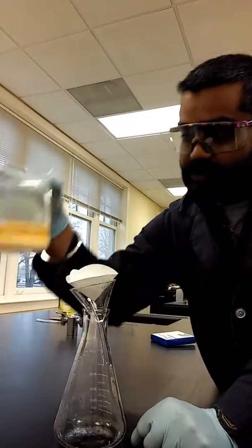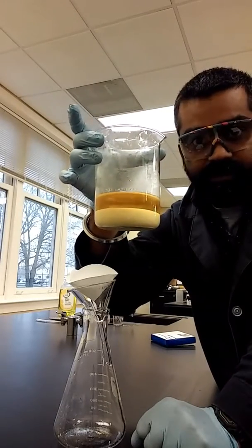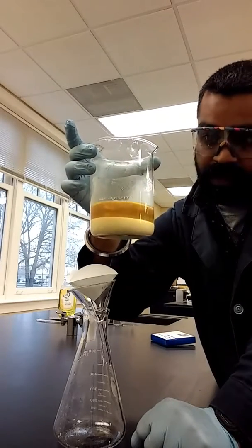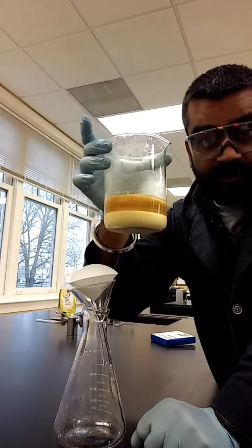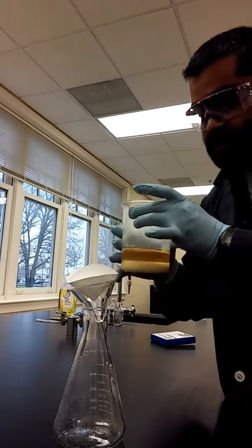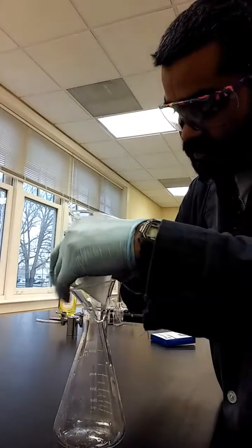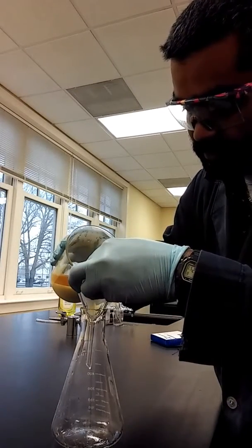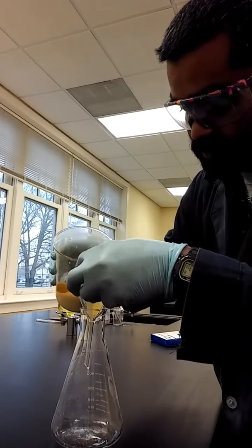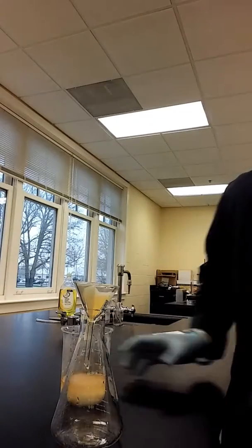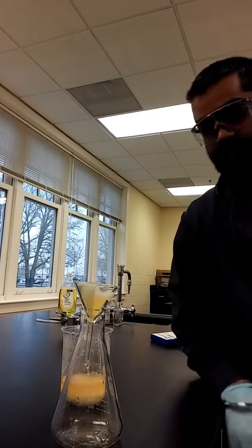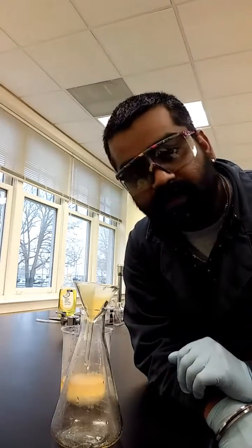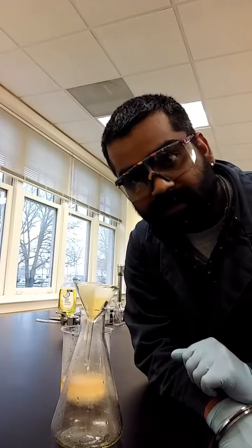Finally, the solution is done and you can see two clear layers. One is the calcium citrate and then there's also the aqueous layer. We're going to first filter it. So this is step three. Try your best not to disturb the mixture so that your solution goes through the paper really, really quick. You really don't want to mix it. Let it stand. All right. So I'm going to filter it. And when the filter procedure is done, I'm going to get back to you with step four.